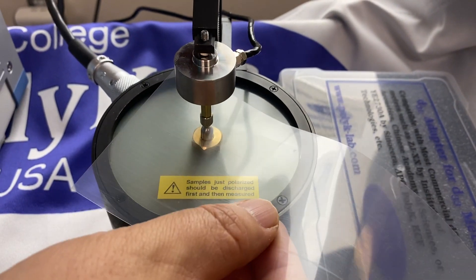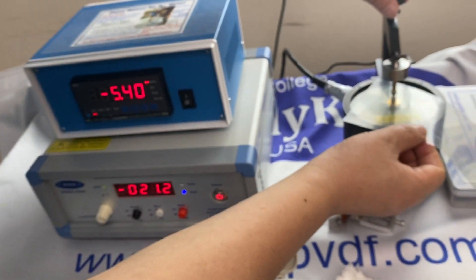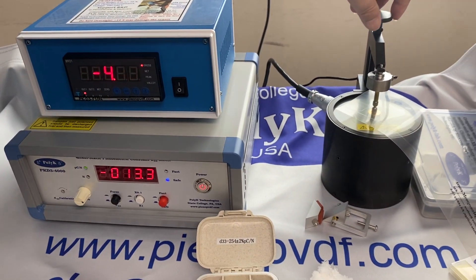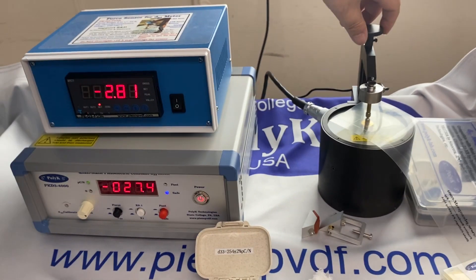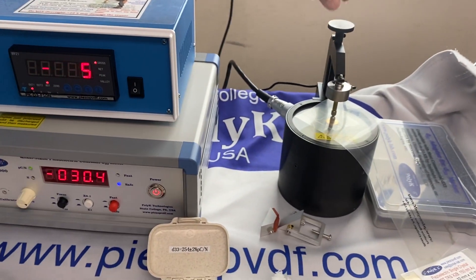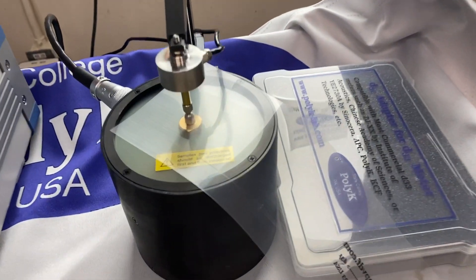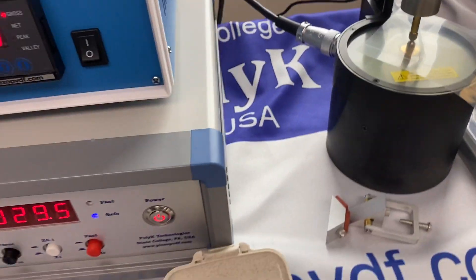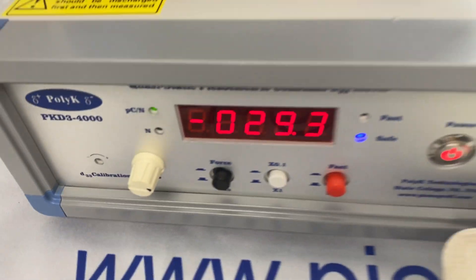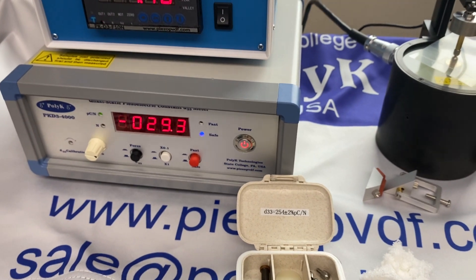If I measure the negative surface at the same spot with the same force — about 2 newton — I get about negative 29 to 30. Usually the top and bottom surface give one positive and one negative reading, and they should be the same magnitude. If they are not the same, you can take an average, or use the zero knob to adjust.